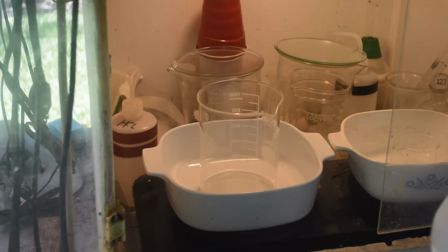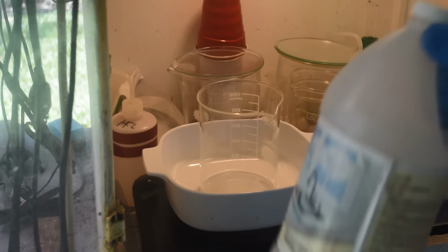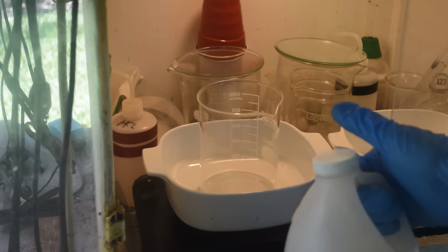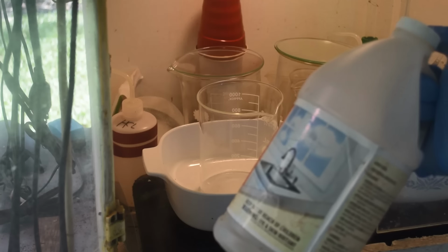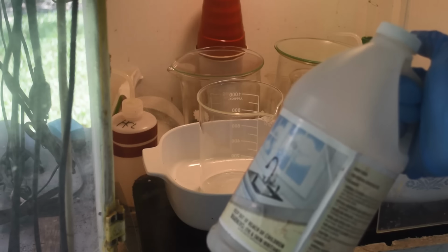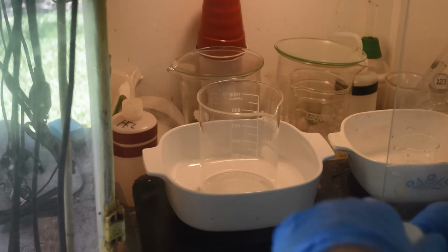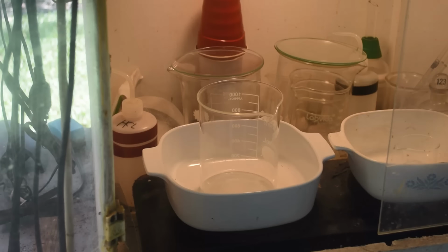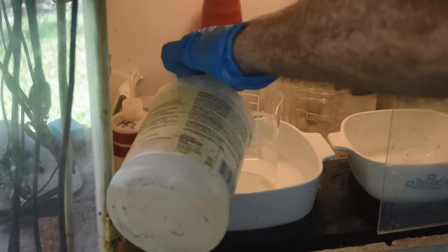So now, according to Hoke, what we need to do is add enough ammonia to this stuff for it to go slightly basic. All right, we're going to neutralize all that formic acid with ammonia. And then, once we get it slightly basic, we're going to add enough formic acid back to it to make it slightly acidic. So that's what we're going to do. And she says there may be considerable popping and fizzing, but we will give it a try and see what happens. It certainly looks like it's getting hot.